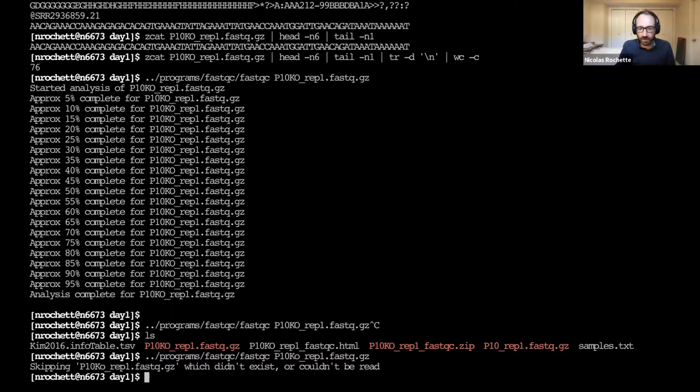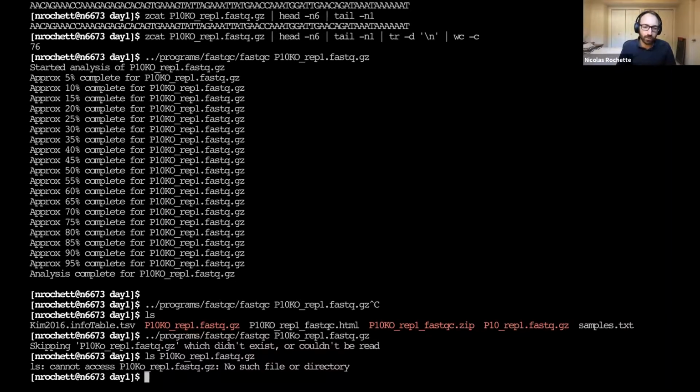And so I could fix this and make the command work, but the point was to show you. Let's say I haven't seen this, and I'm just like, this is weird. This entire command here, which here is very simple, but this might just be part of a much more complex command like the one for Trimmomatic, right? And then the error is this one file didn't exist, and clearly that was not my intention, right? And so whenever you have an error of this type, the first thing you can do really is just confirm that the program is actually telling you something that makes sense. And so the way you can do this is just take the path and then put it in ls, and then ls is also in principle going to tell you, yeah, this doesn't exist.